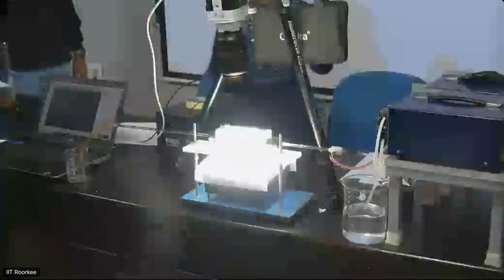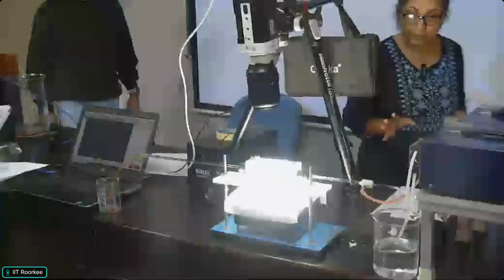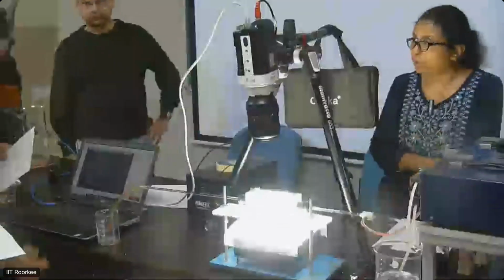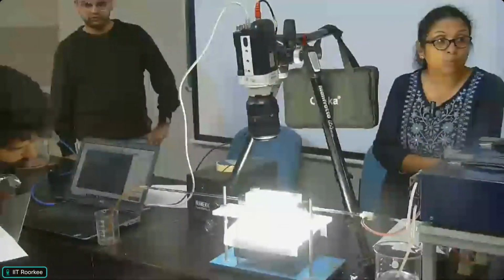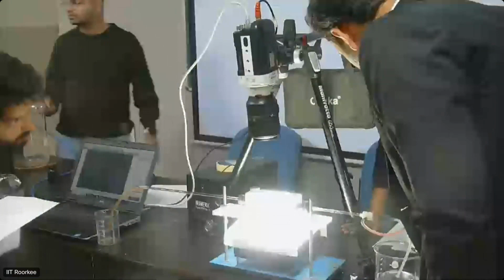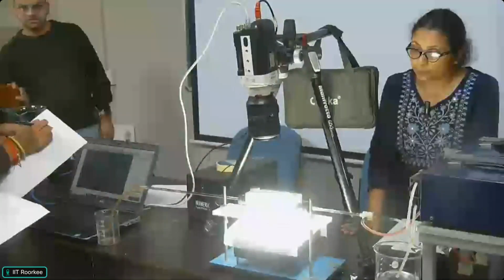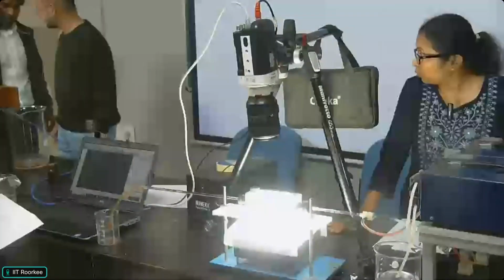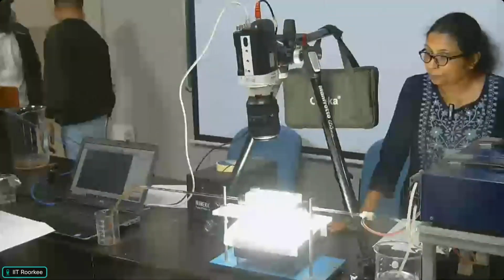So, have you understood the difference? Have you seen the changes of the two fluids? You can see how the characteristic changes when you increase the flow of water to 3. Initially it was 2, now we have increased the flow of the continuous phase. The green color is the dispersed one. Can you see any changes? Anyone?